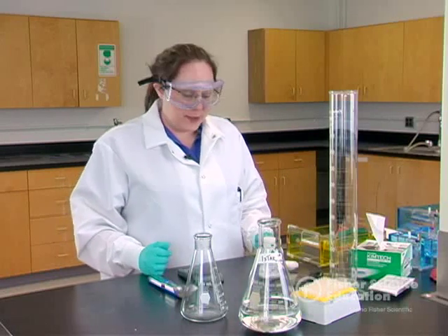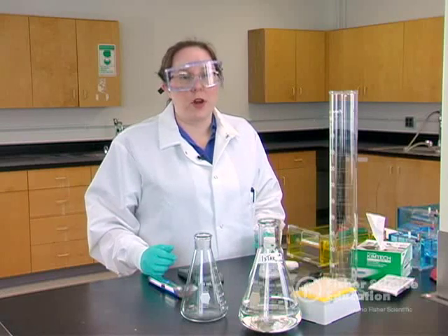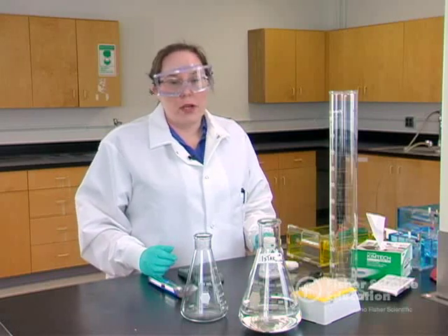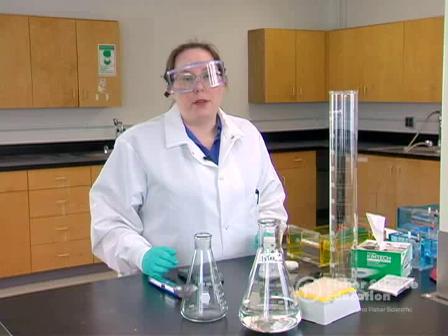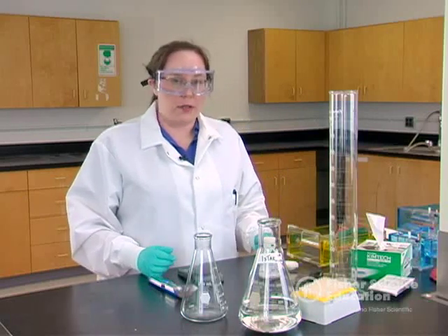Today I'm going to prepare both large batches and small batches. I'm going to start with a large batch, and for that I'm going to pour several gels. I'm going to use 300 milliliters of 1x TAE and 2.4 grams of agarose powder, which will prepare 0.8% agarose gels.